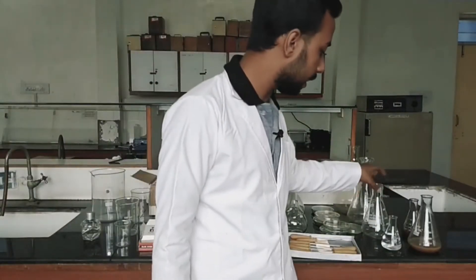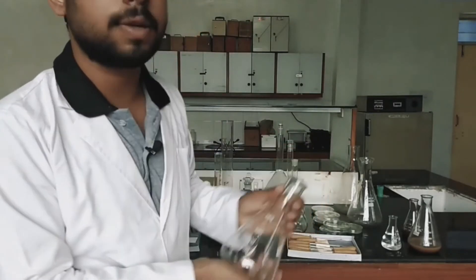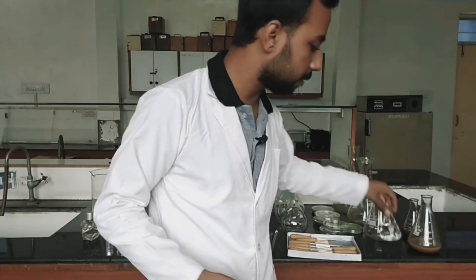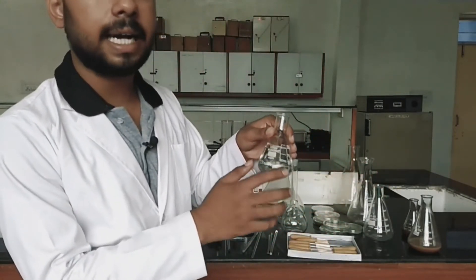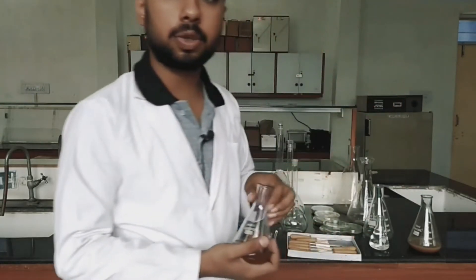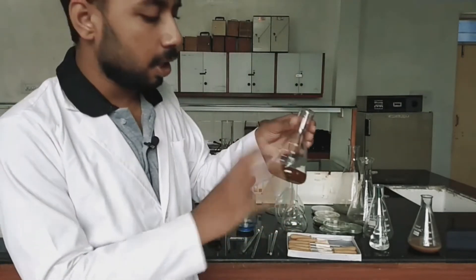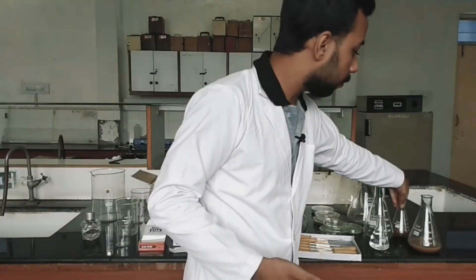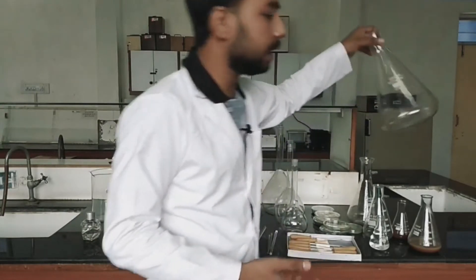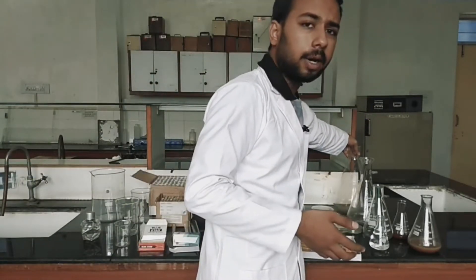Starting with the first glassware, we will go serially through all glasswares. The first one is the conical flask. As it is cone shaped, that's why it is known as a conical flask. The conical flask is used to store different types of liquids. For example, this one is 100 ml. In microbiology, we can use these conical flasks for preparation of culture media — such as EMB agar. It is also used for storage purposes and is available in different sizes, such as this 2000 ml conical flask.